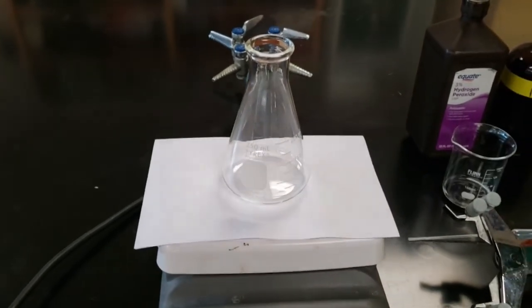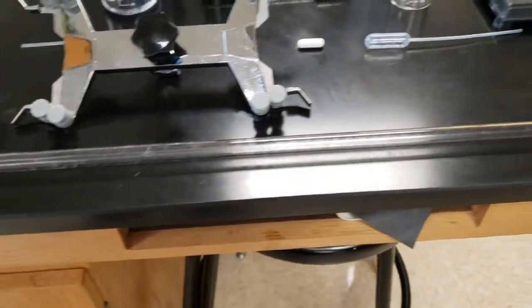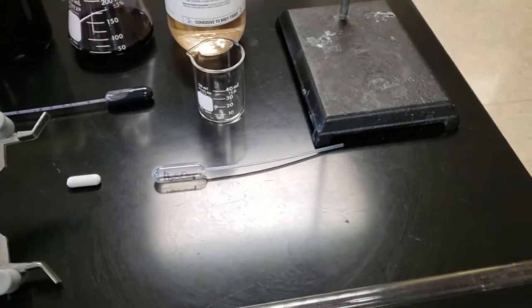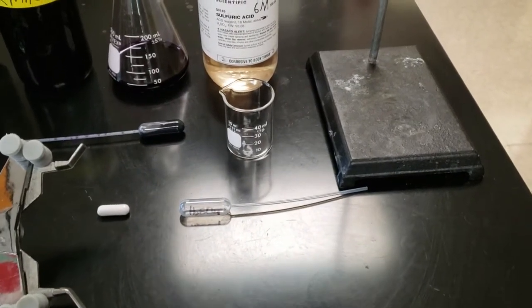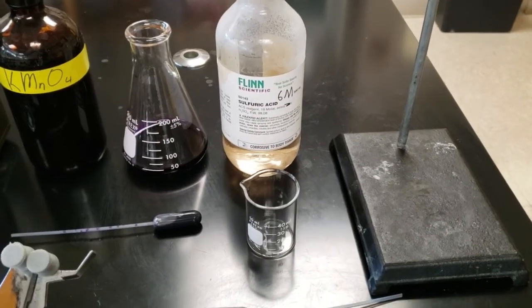This stir plate is discolored, so we put a white piece of paper on it so we can see the color change. Here's a 50 milliliter burette, a disposable pipette, a stir bar, a second disposable pipette, a couple of storage beakers that are clean to hold the chemicals we need. We need a ring stand.